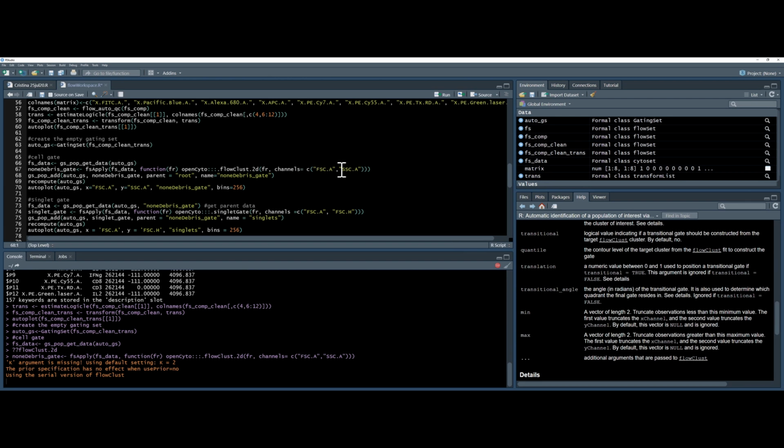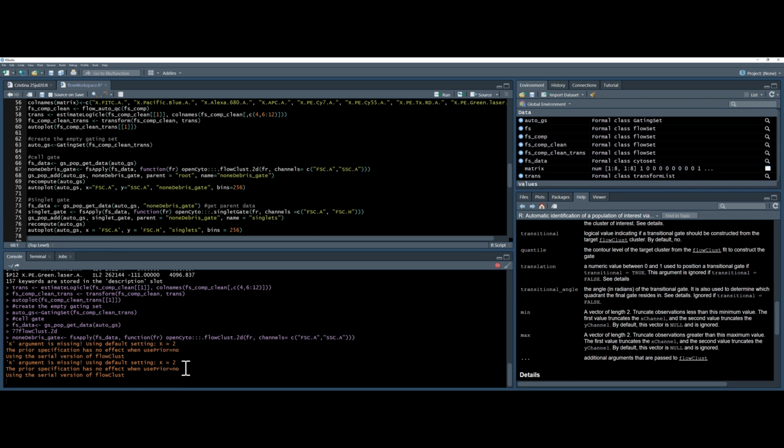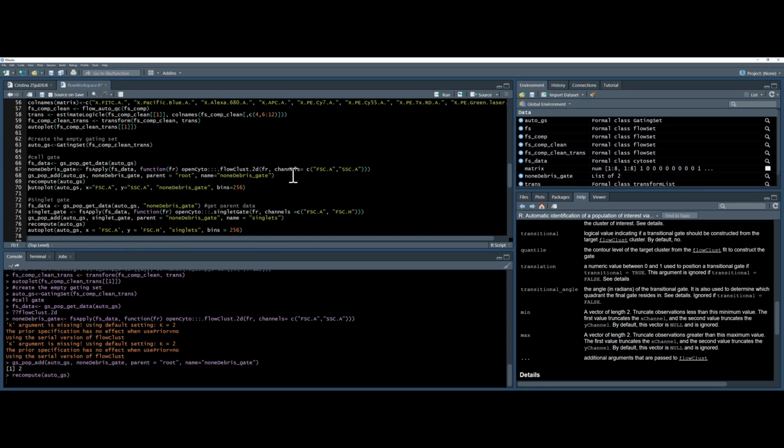So it's looking through channels forward scatter area and side scatter area. And then it's giving me some errors here, but these are not of a concern at the moment. It's saying that the default for the clusters number is 2. And when we have used prior, there's no effect, so that's fine. And then we're going to use this gating set population add to my gating set, AutoGS. I'm going to add the non-debris gate to the parent root and give it the name non-debris gate. So that is exactly the same as a manual one. Gives me 2, I can recompute.